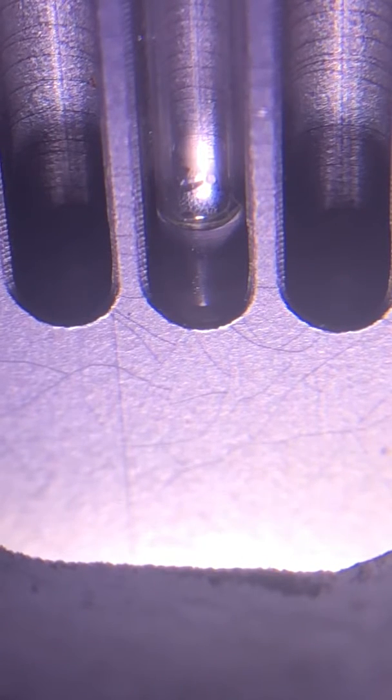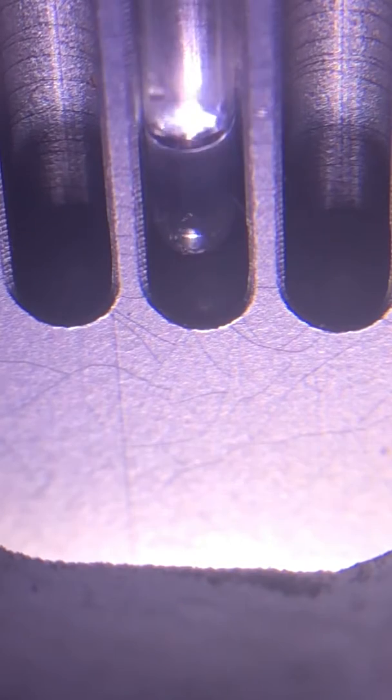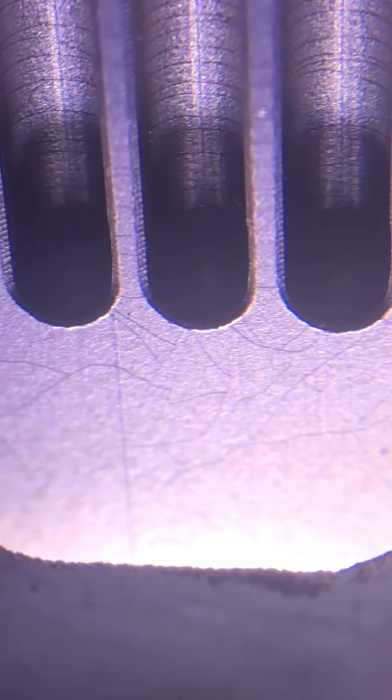And now when we're done what you have to do is you have to hit stop. And it'll cool and once it cools below the melting point, you can run a second sample. And that second sample you can change the ramp rate to be slower and then some of that thermal mass problem goes away because if you heat the sample more slowly, it gives more time for the sample to come to an equilibrium temperature.